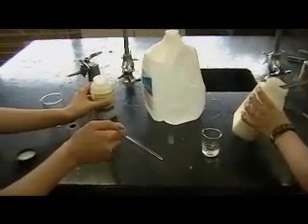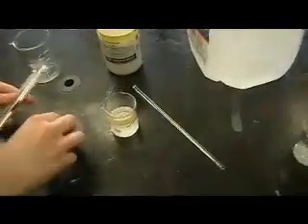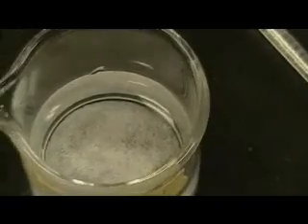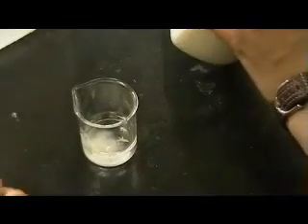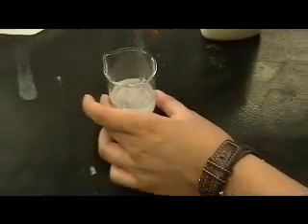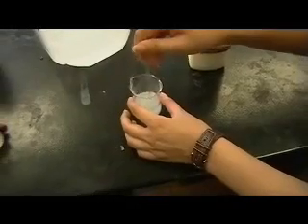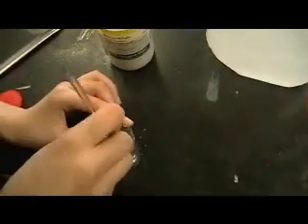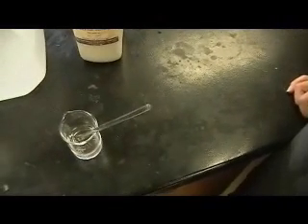To form them into a liquid form, simply take about 1 full scoop and put it into half of a 50 ml beaker. You should mix the solution until all of the solid has dissolved and there is none left, and it is simply a clear liquid solution. Using heat to quicken the dissolving was not recommended, so it is best to simply stir it at room temperature.